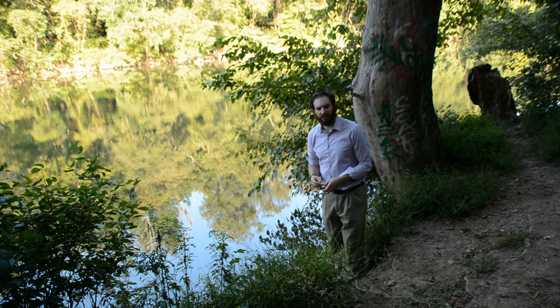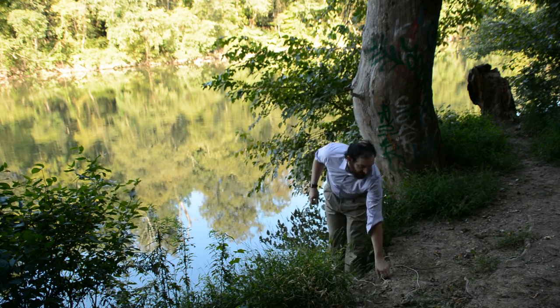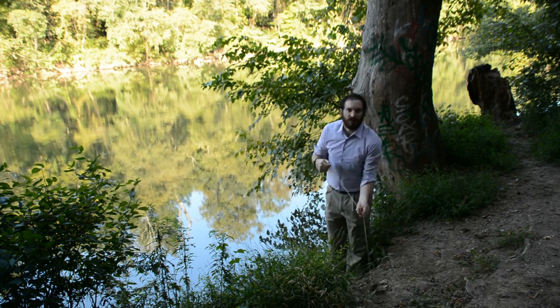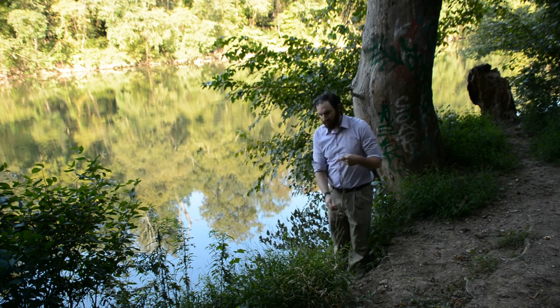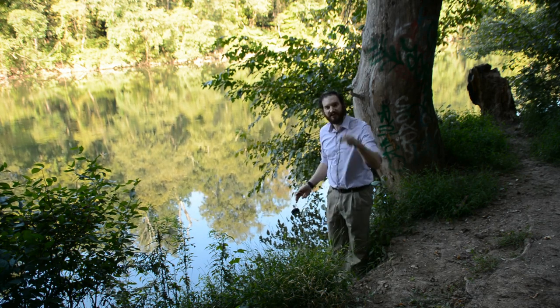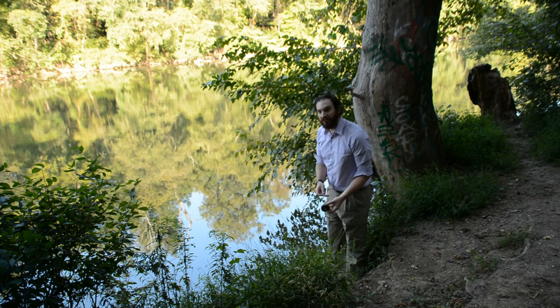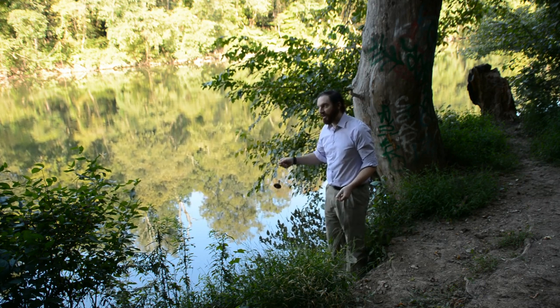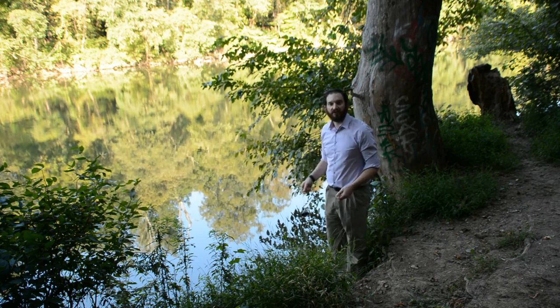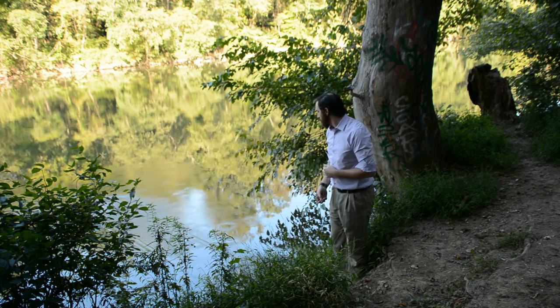I'm going to have to take a break real quick. Got myself a little bit of a knot here, so I'm going to pause the video and come back. Alright, I'm back. I've got the knot untied, and I've got my weight here. So what I'm going to do is toss my weight way out there, and I'm going to tie off this retrieval line to the shoreline. So hopefully this all works, and this weight will eventually, over time, pull this apparatus out further into the water. There it goes.